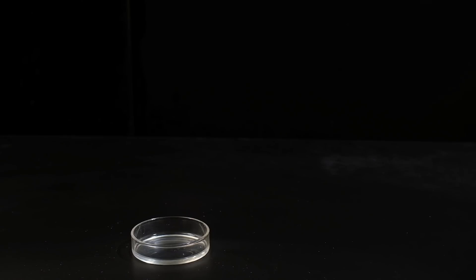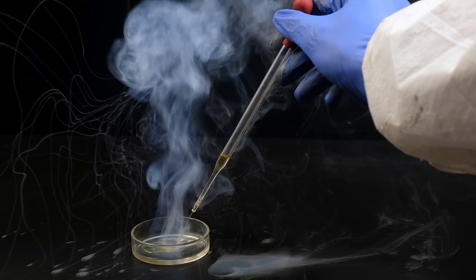The color of the flame can become saturated if you take more boron tribromide.